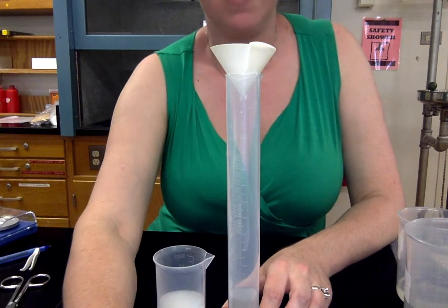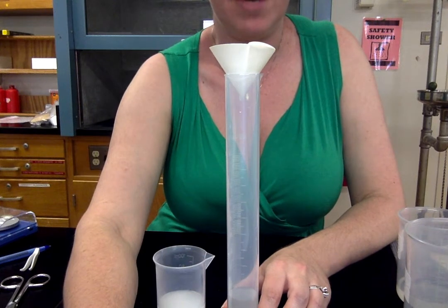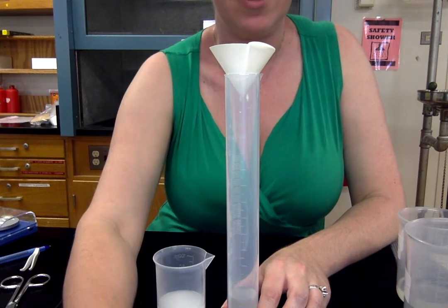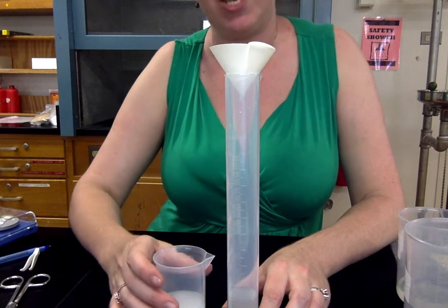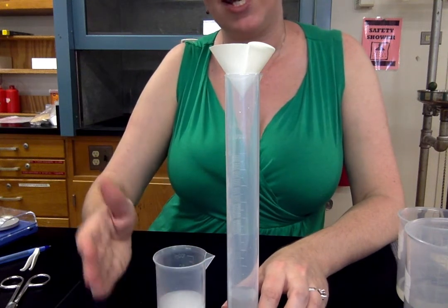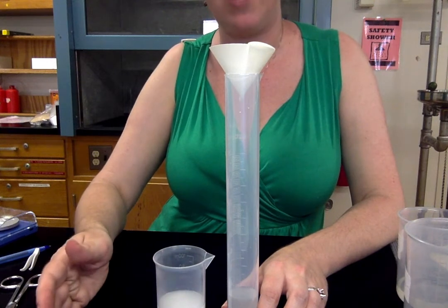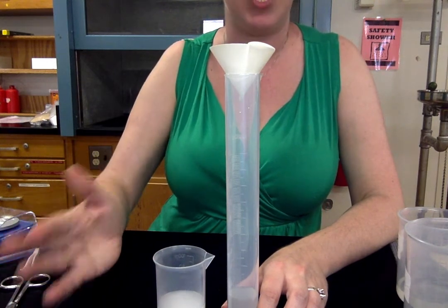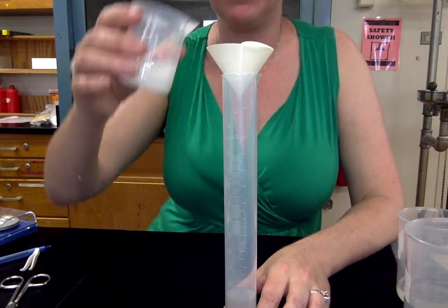This is not the lab where you're going to measure it at different time points. You're just going to wait 48 hours. It will be good and dry by 48 hours. If you don't have 48 hours, or if you check it at 24 hours and then at 36 hours and it's the same weight, it's probably dry enough. 48 hours is a good, safe time though.